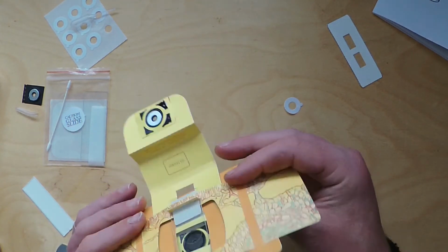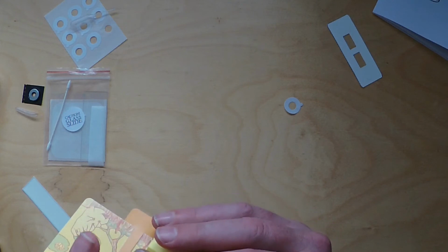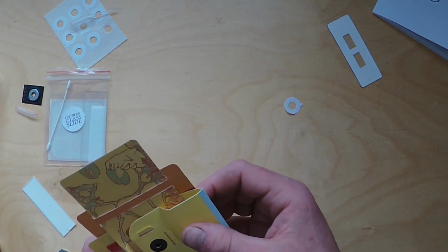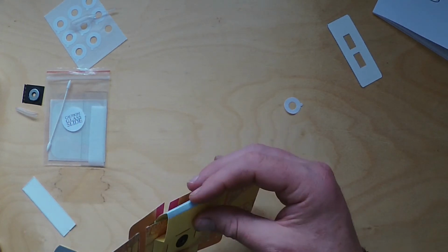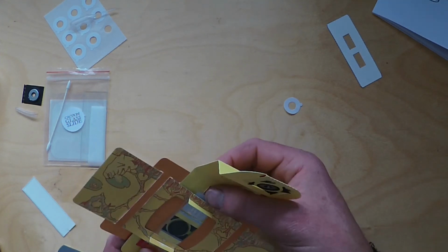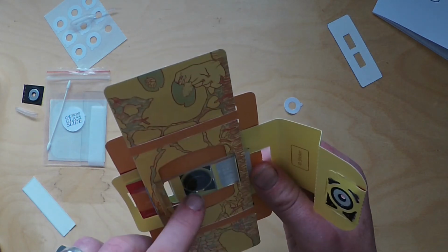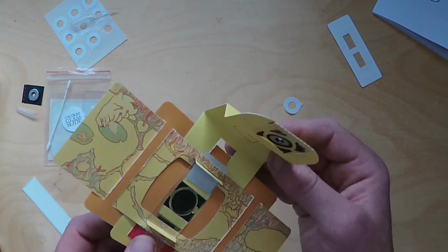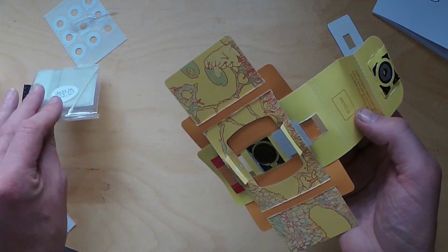And now if you take that, you let this bit at the back, you'll see the reason we fold it up is that it snaps to the lens. You've got space for light to come in, but it also keeps the sample in a good position. So let's just get that position there. You can see if you hold it up to the light, you'll be able to just see the sort of pink of the sample through the lens hole there, and let that magnetically clamp on there. You can put an ID sticker to give you a Foldscope specific ID. The sticker's in there, but I'll just leave that for now.